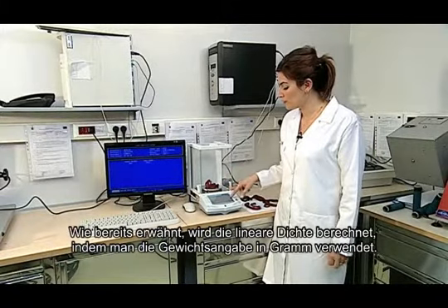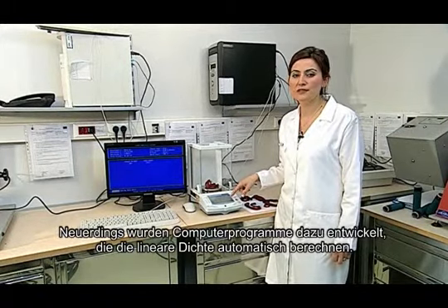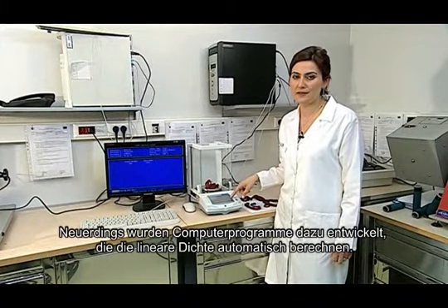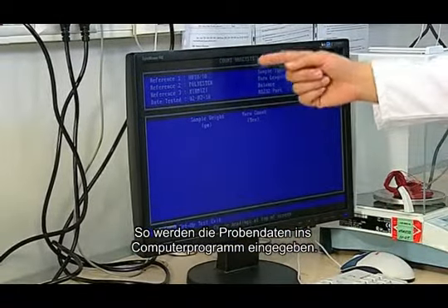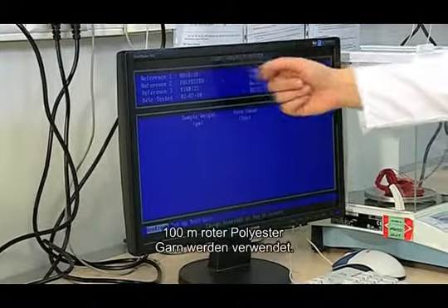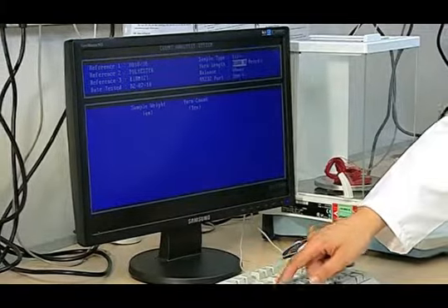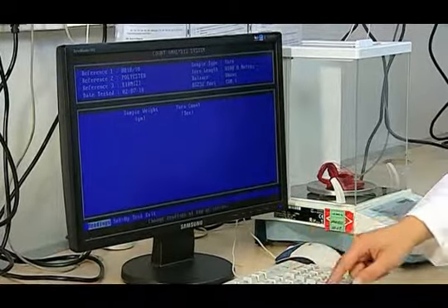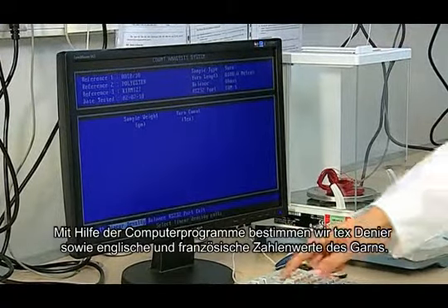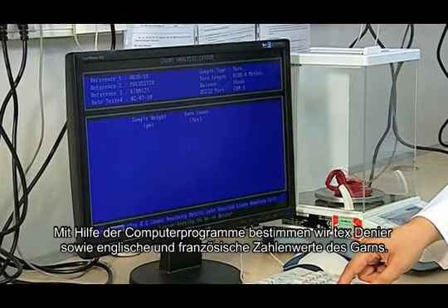The linear density is calculated by taking the weight in grams as mentioned before. Recently, computer programs have been developed for this task and the linear density of the yarn is calculated automatically. Thus, the sample's data is put into the computer program. The red polyester yarn is taken as 100 meters long. The length is taken in meters. Computer programs help us find the tex, denier, English number and French number values of the yarn.